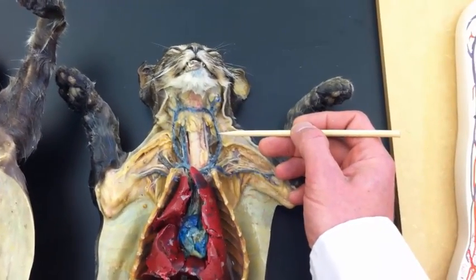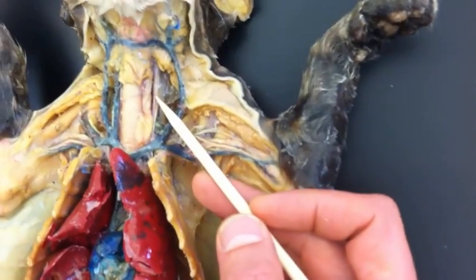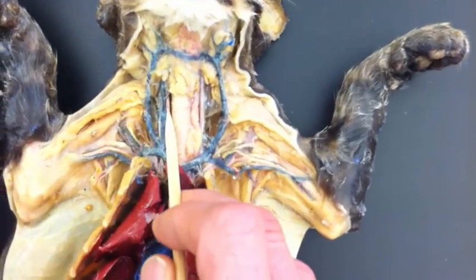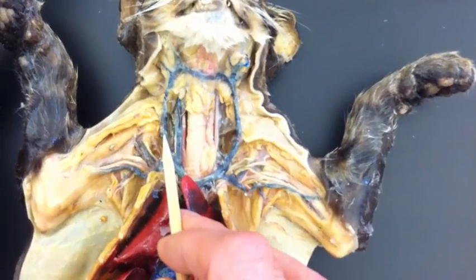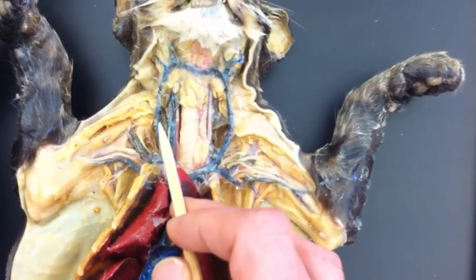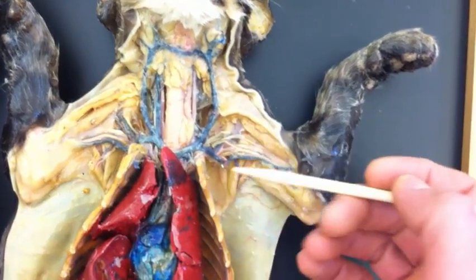This would be a jugular vein. This is the left jugular vein on this cat. And I've got to get close, but can you see this small reddish looking vessel going up here? That's the carotid artery. This would be the left carotid artery, and here's the right carotid artery. There are two jugular veins on this side. This is an internal jugular and external jugular. For my students, if I just point to any of these blue ones in the neck, that's jugular vein. So in this case, it'd be like right jugular vein.